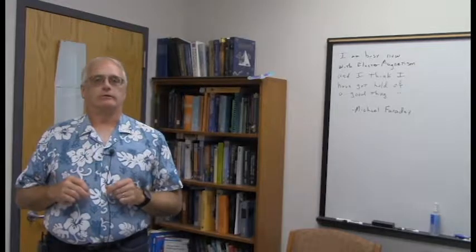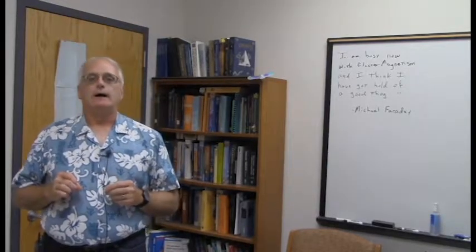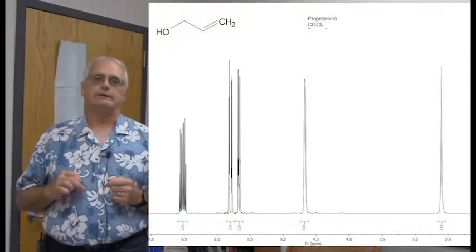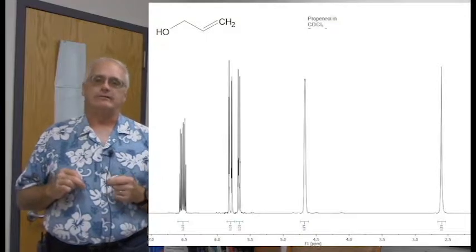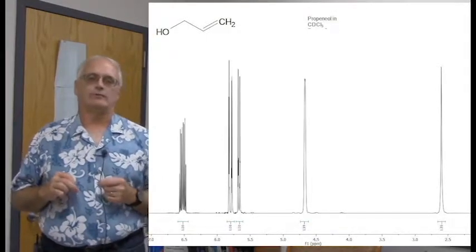Now, there are three molecules I want to look at, and the first one is pretty simple, a simple propenol. And here's the molecule and its proton NMR spectrum. Nothing unusual here. We see the pieces we would expect to see. It's a fairly simple little molecule. We see the alcohol group integrating a little bit on the high side, as wet samples often do.